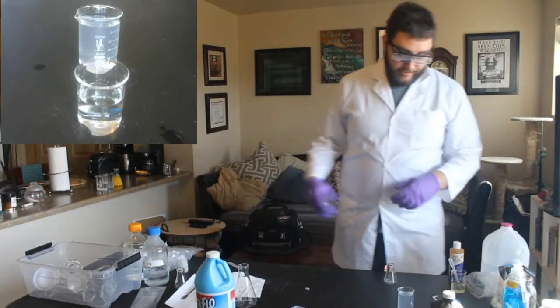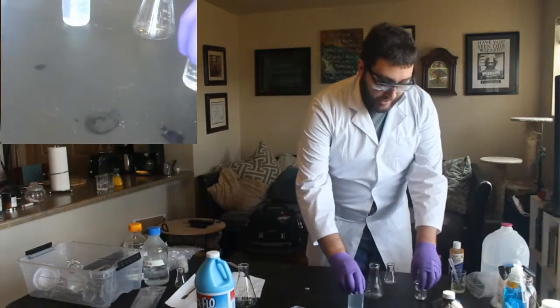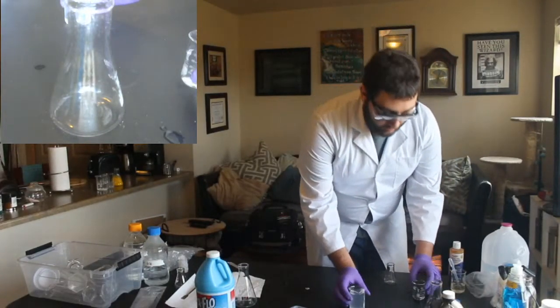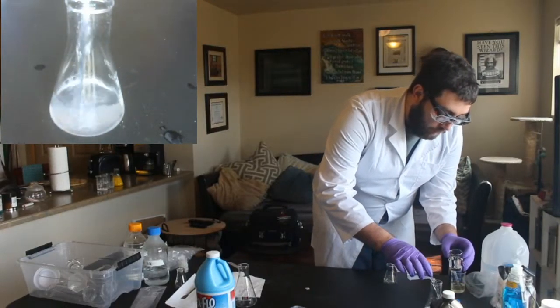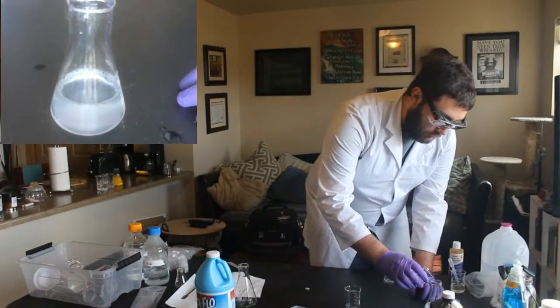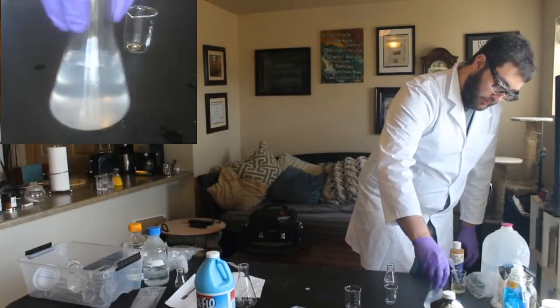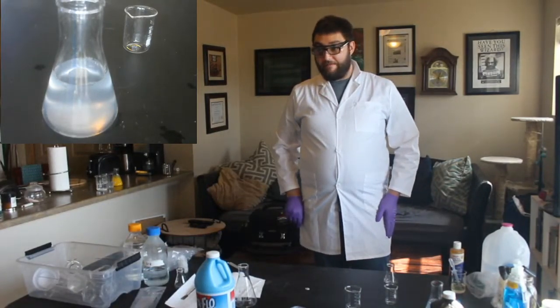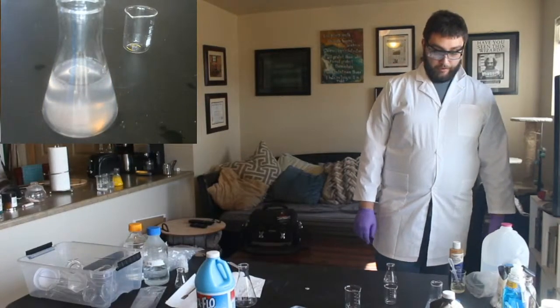Okay, hopefully we've got most of that stuff out. So now what we're going to do is we can combine this, and this time it's going to have a lot less vitamin C. In fact, I'm going to add all of one and then all of another. Here we go. Give it one good swirl, and then we'll just let it go. And hopefully this is enough this time. There it goes. It's changing already.